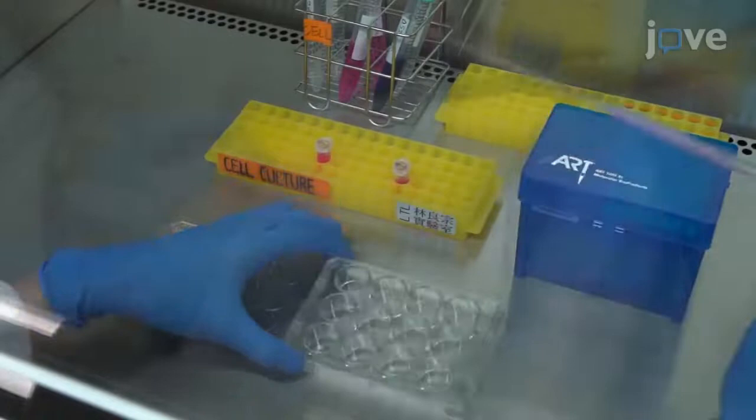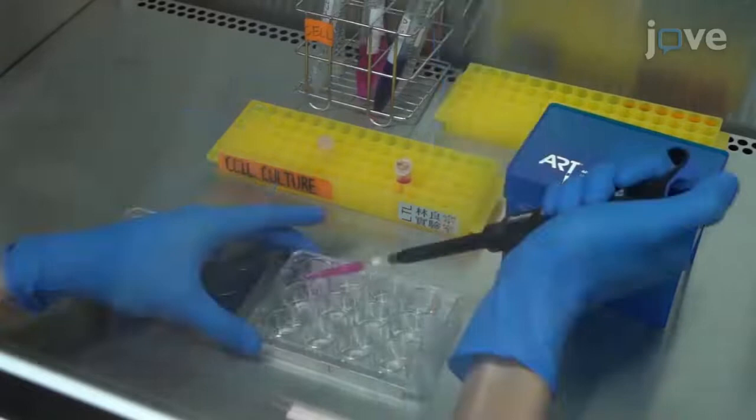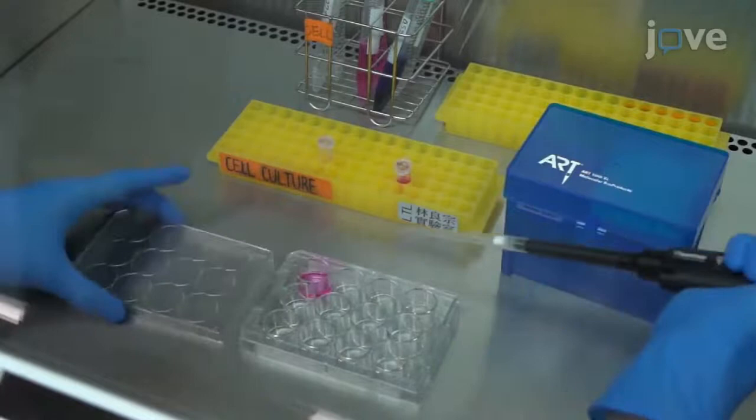The next morning, treat each well of the RD monolayer with a test compound of interest in triplicate at non-toxic concentrations in 1 mL of basal medium for 1 or 4 hours.